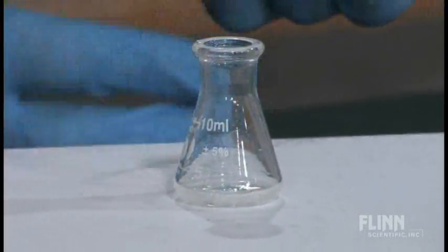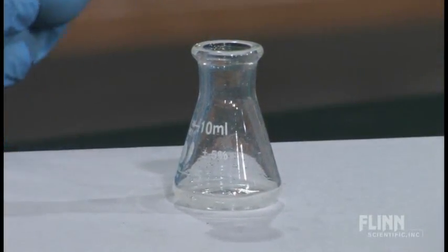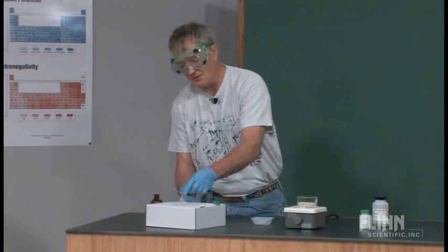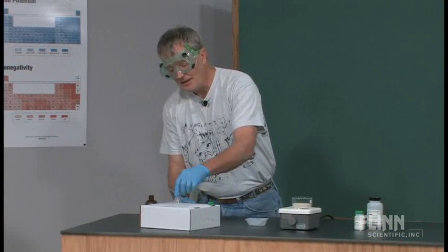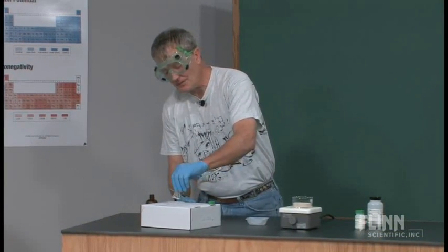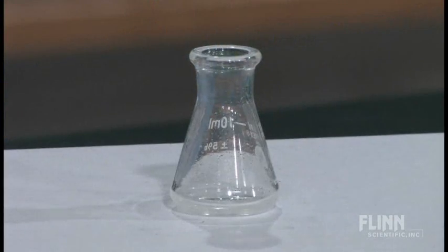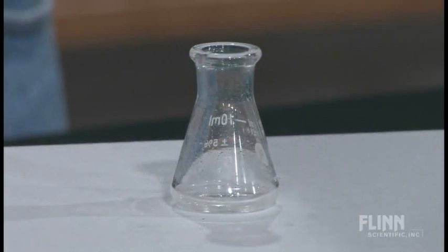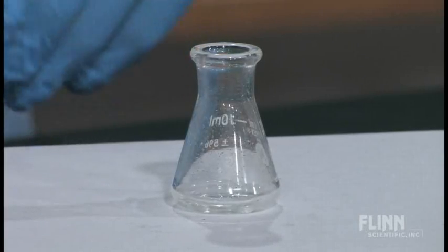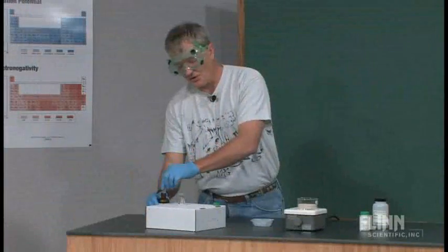But very quickly that dissolves. I would do this probably in a fume hood in my classroom, at least this part of the lab. And that will just cut down on the small amount of hydrogen chloride that off-gases from the concentrated or the high concentration HCl I'm working with.